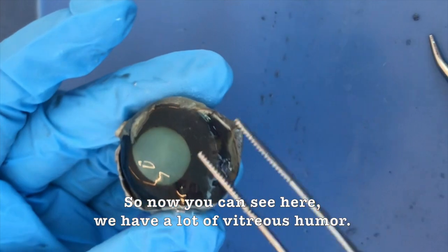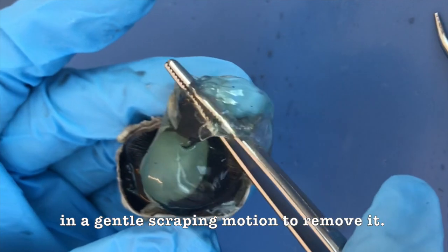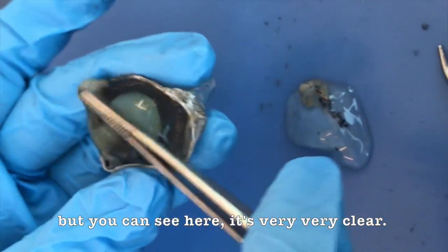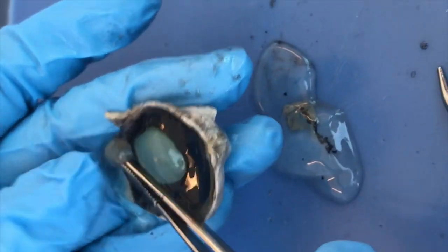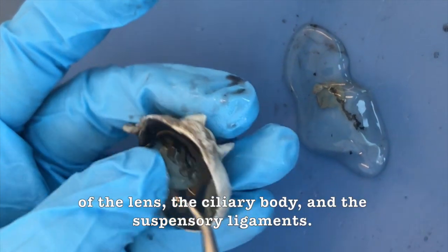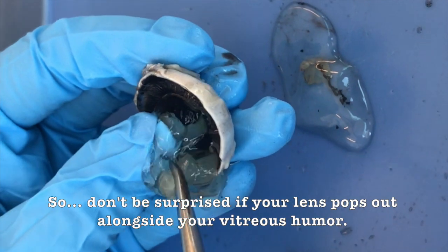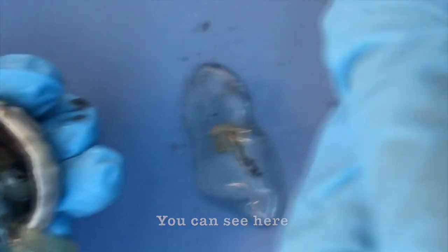So now you can see here we have a lot of vitreous humor, so I'm going to use my forceps or my probe in a gentle scraping motion to remove it. Again, this may appear cloudy in some specimens, but you can see here it's very, very clear. So this is going to reveal the posterior view of the lens, the ciliary body, and the suspensory ligaments. So don't be surprised if your lens pops out alongside your vitreous humor. You can see here that's exactly what happened.